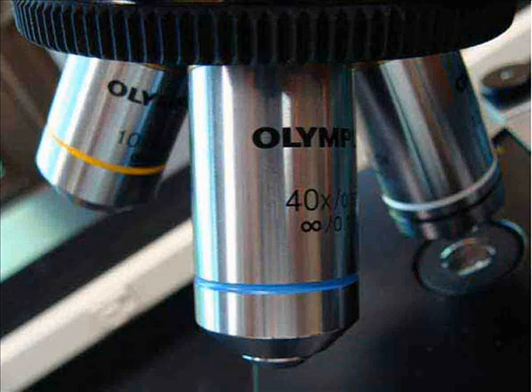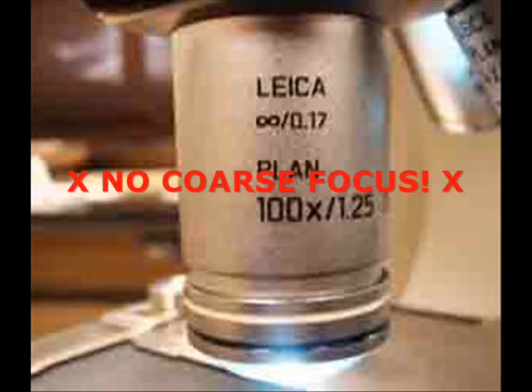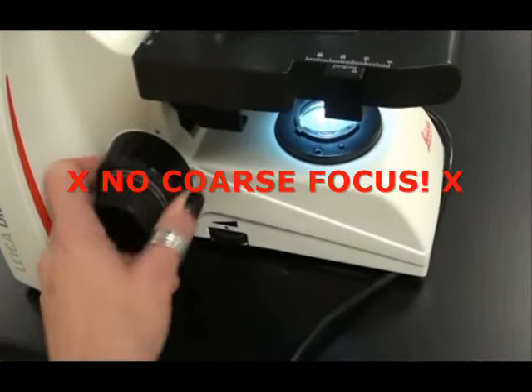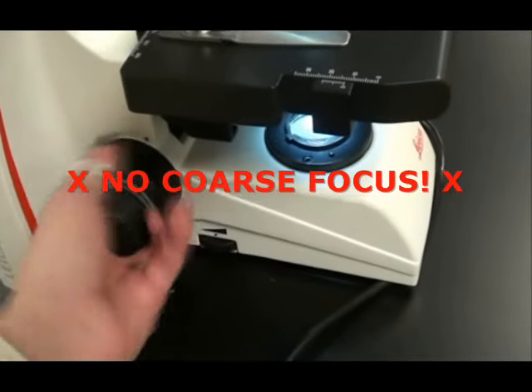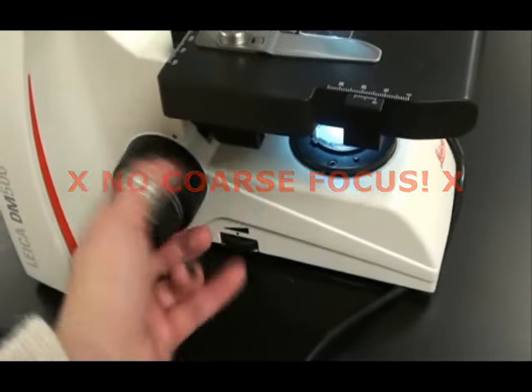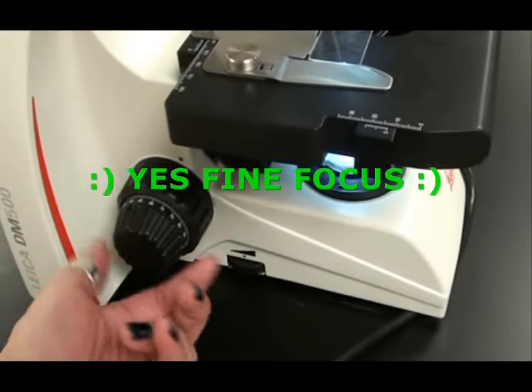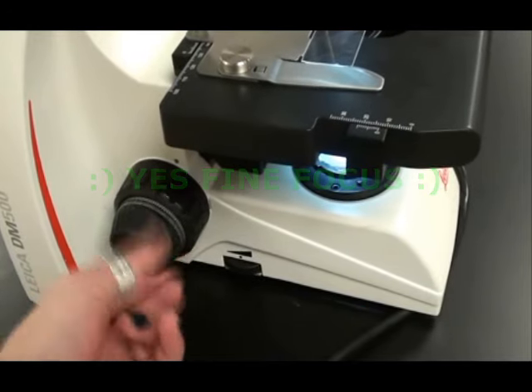An important warning: whenever you are using your high dry objective or your oil immersion objective, these are your two longest lenses. Never adjust the coarse focus. When you are using these longer lenses, you are only allowed to use the fine focus. Again, that knob that is set within the coarse focus knob.